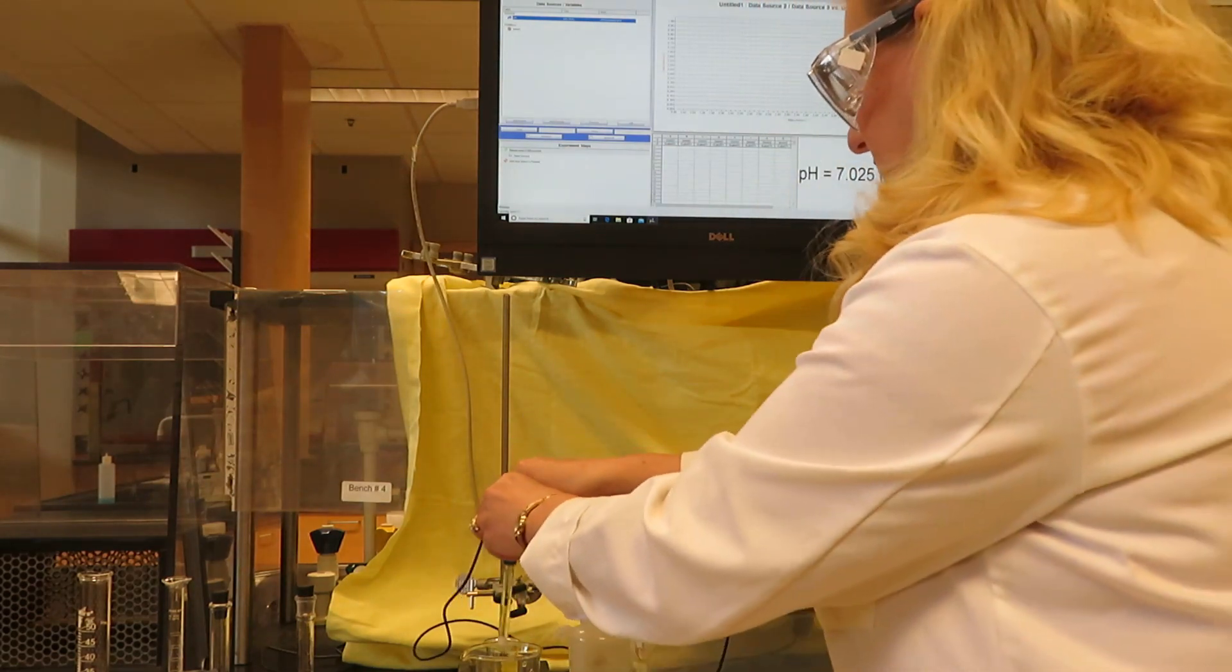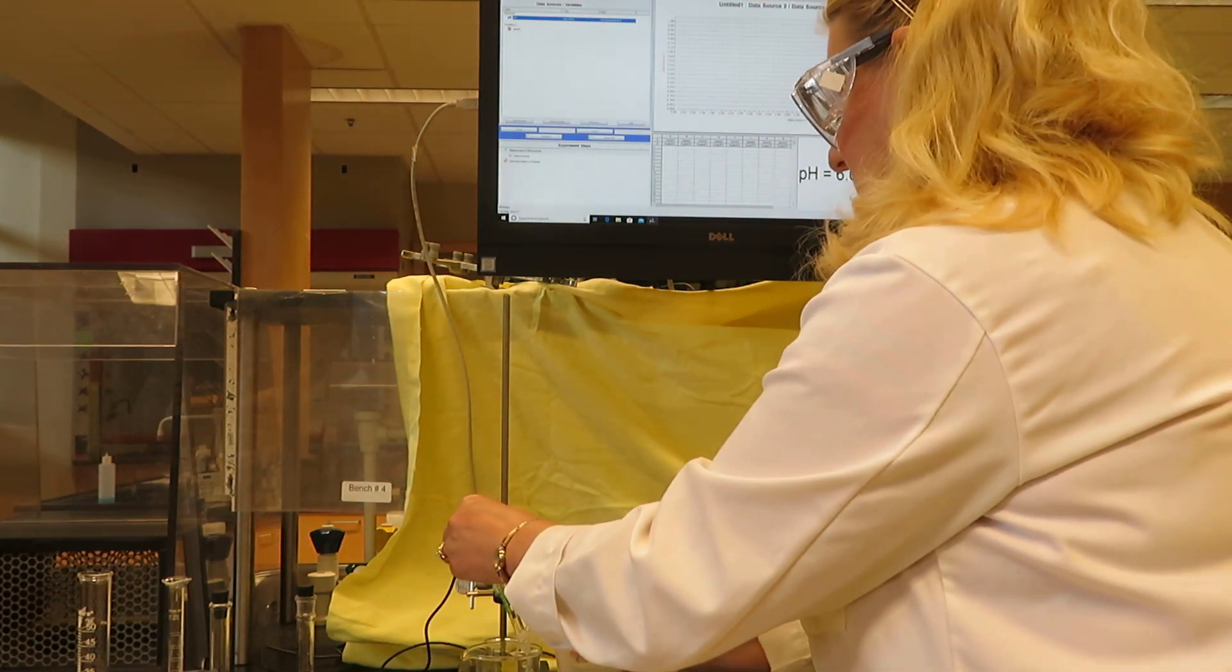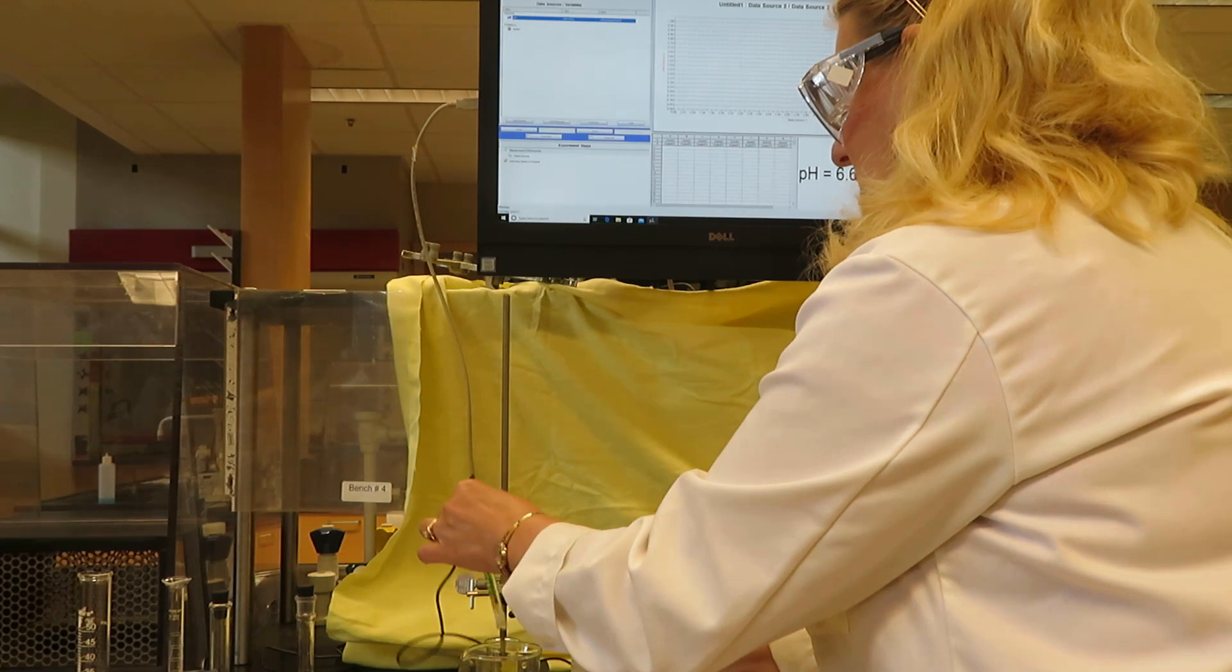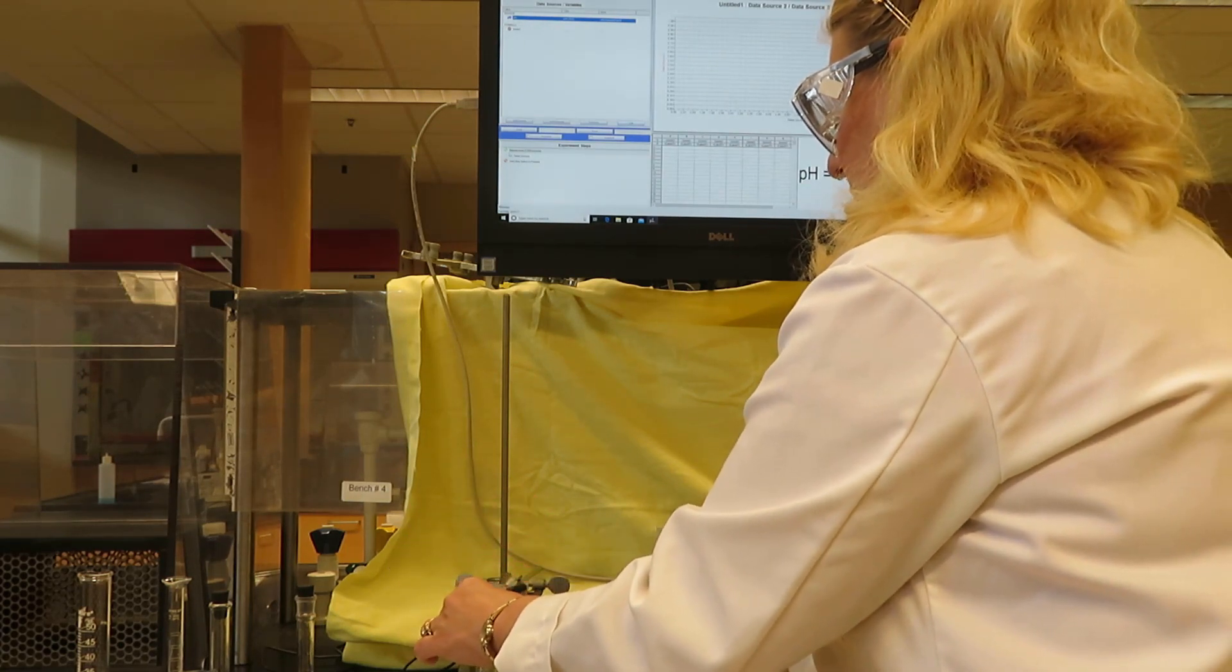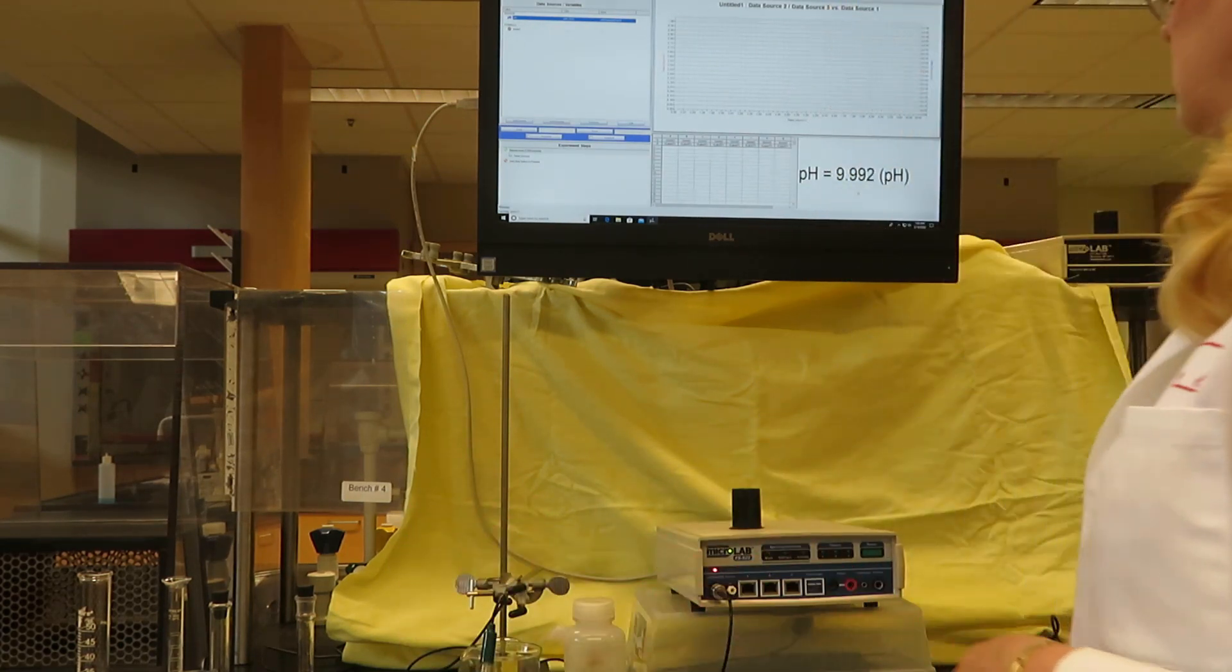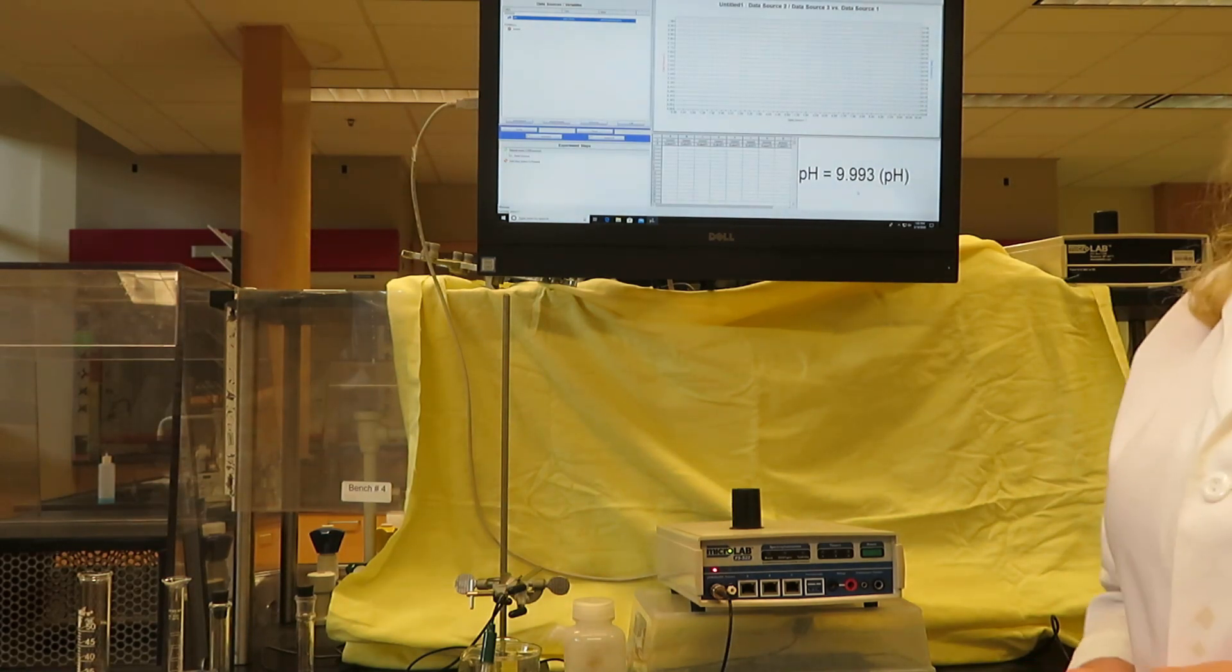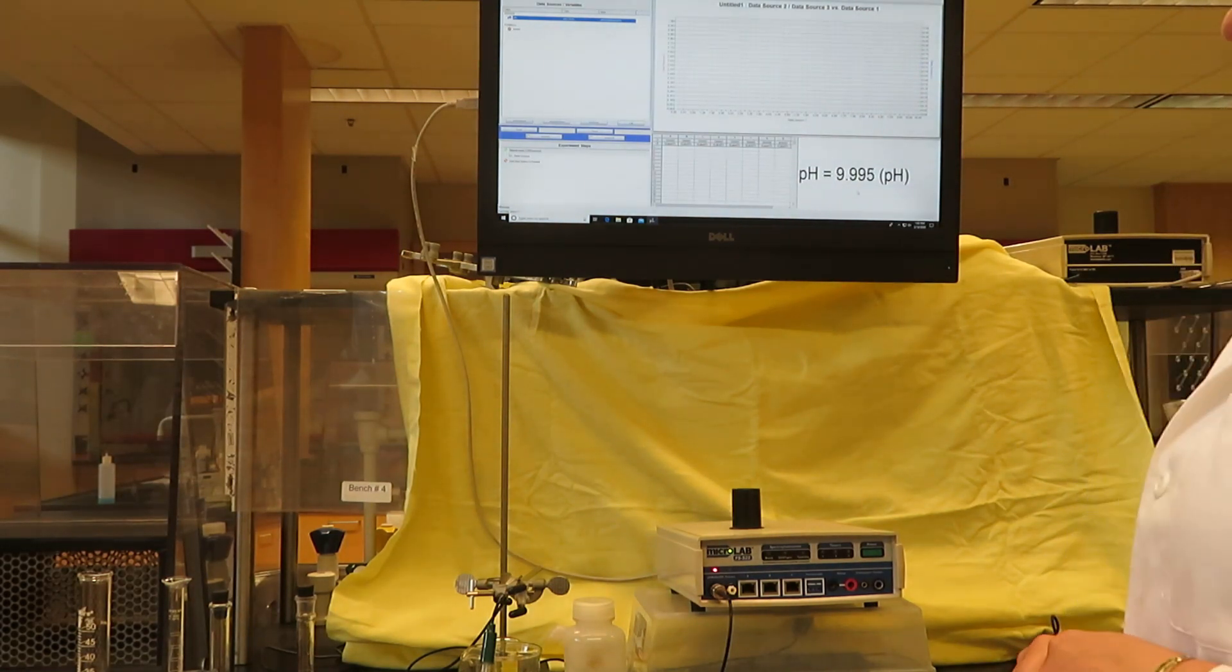I'll try our last one. Let's see how close we got. That is reasonably close to the pH 10 buffer - it's reading 9.995.